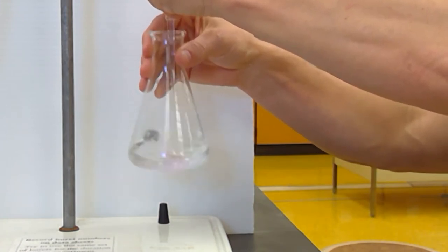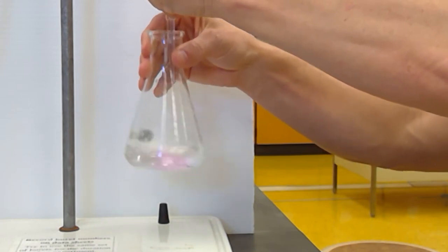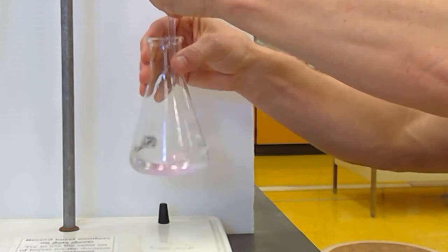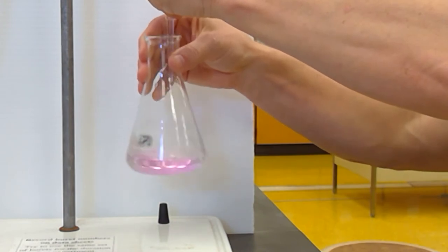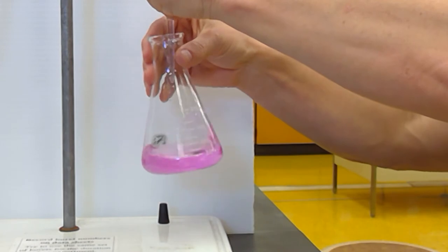We want to get the faintest pink color we possibly can, but not on the first run. We're going to back titrate it. This will save you a tremendous amount of time and a tremendous amount of anxiety because you can't screw it up. Okay, see how that pink is lasting a little longer? See, if I stop, right? So I'm adding even more. I'm way past the endpoint right now.